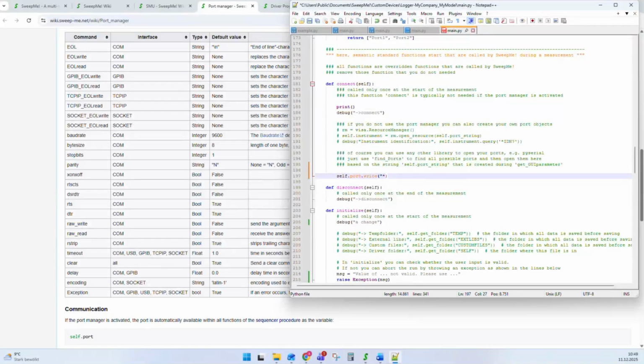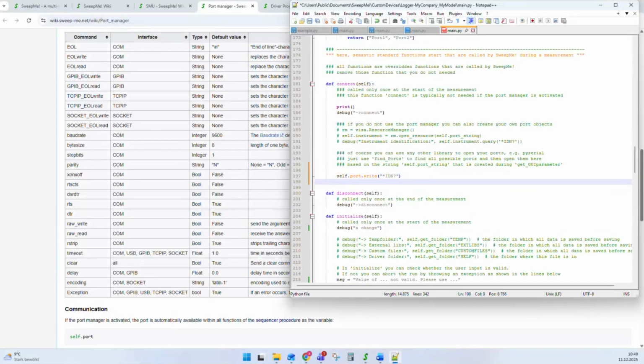And you can send a command like *IDN?. I guess a lot of people notice this is the typical SCPI command for getting the identification of an instrument. And if I want to read it, I can use ID equals self.port.read. That's all. You don't have to add any terminator or end of line character anymore. You don't have to care about the encoding. You really just are chatting with your instrument. That's the idea, to make it really easy.